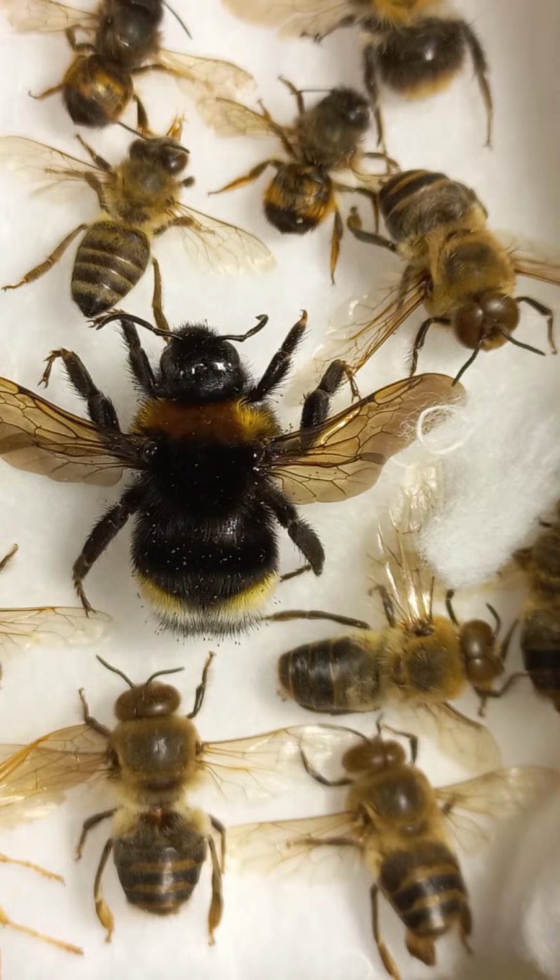Removal of the pollen from the pollen combs is accomplished by rubbing the legs together so that the pollen is squeezed from the inner side to the outer side of the legs. The pollen will be deposited eventually into the depression called the pollen basket. When the pollen baskets are full, the bee returns to the hive, back into the cell, and deposits the pollen pellets.